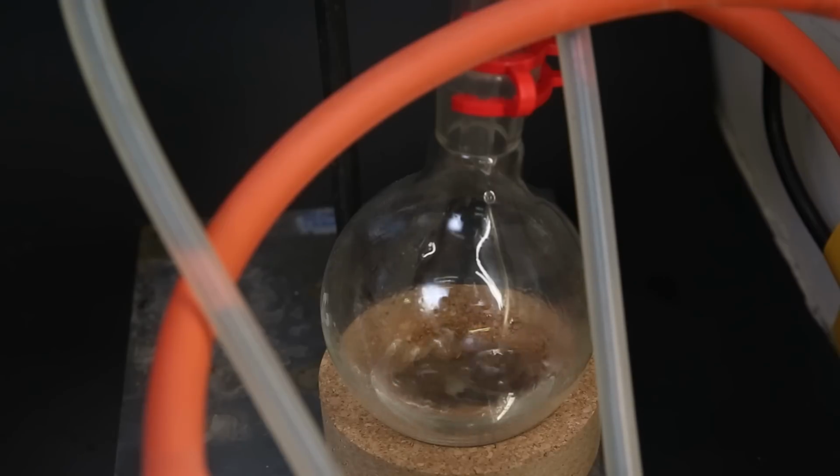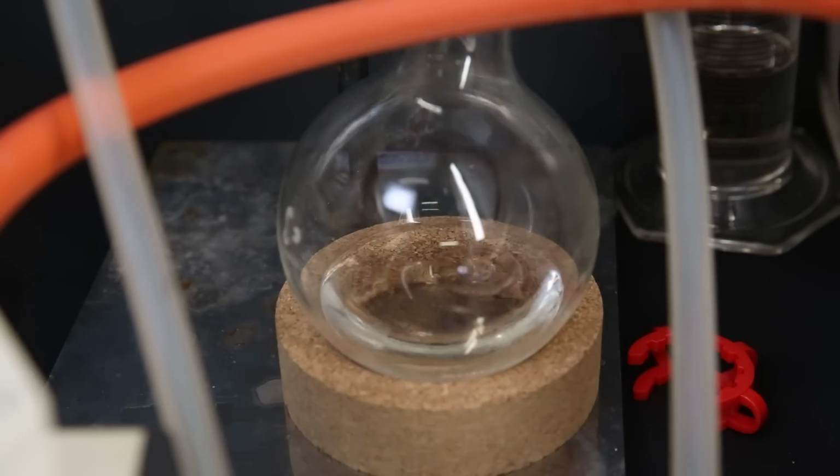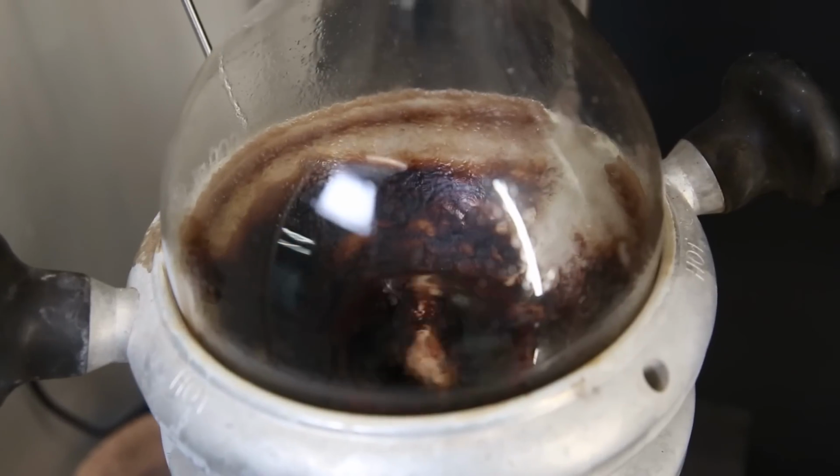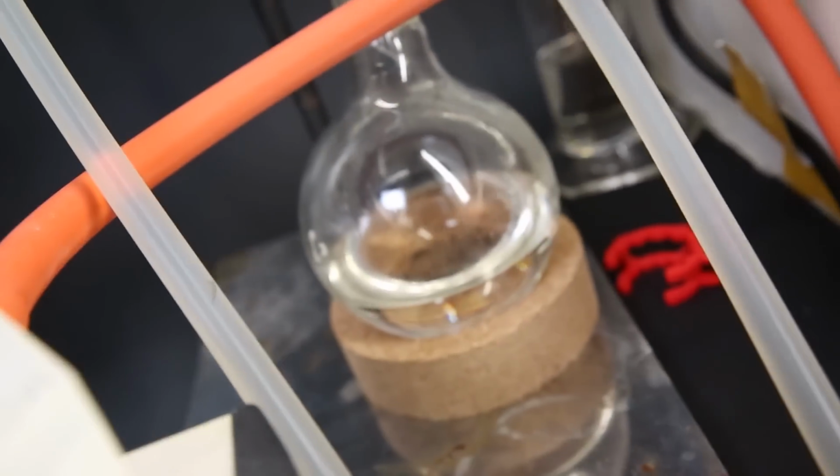I adjust the vacuum and temperature to make sure that it boils continuously without boiling over into the condenser. So now it is mostly collecting toluene and pyrrolidine, and after a while I poured it out and started collecting the next fraction, which should contain cyclohexanone and my enamine. And in the end, everything has distilled over and all that is left is some oxidized junk.